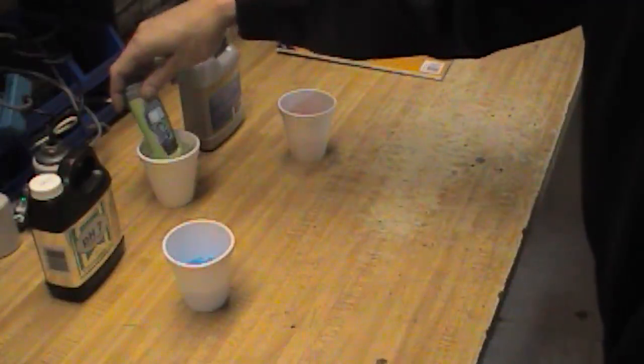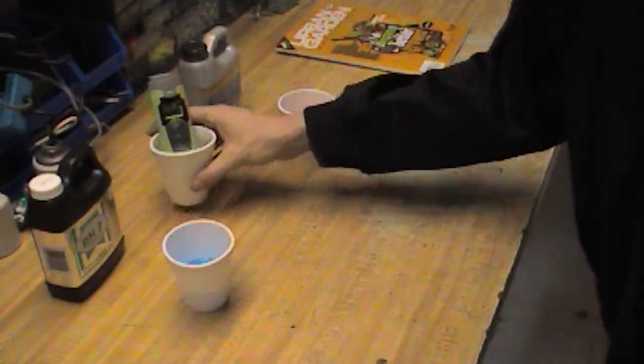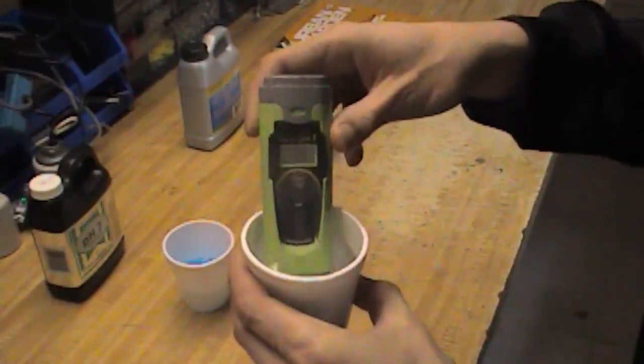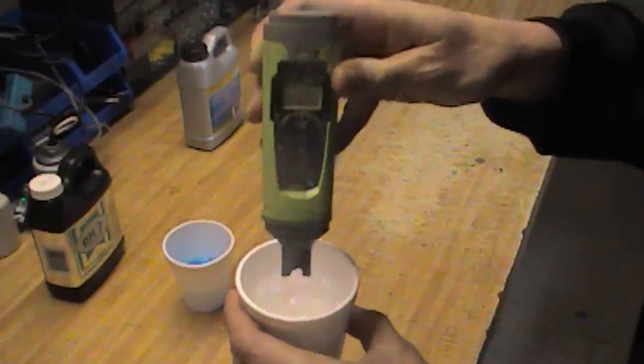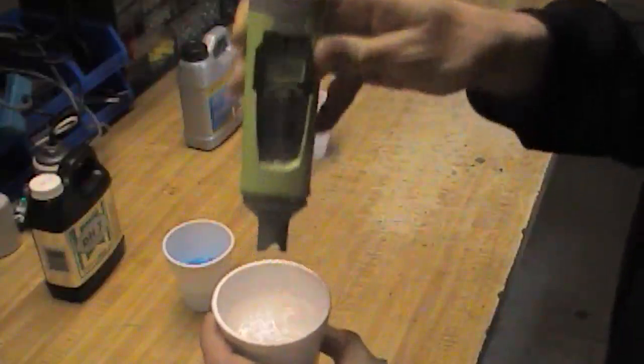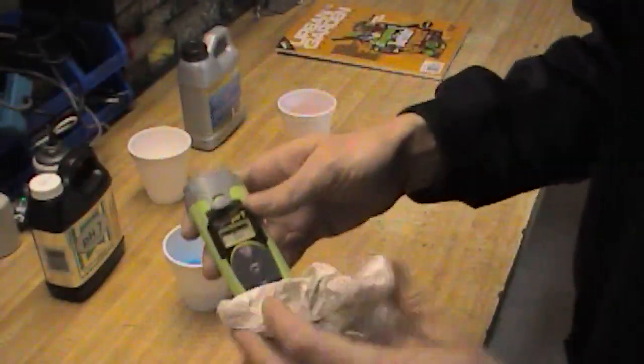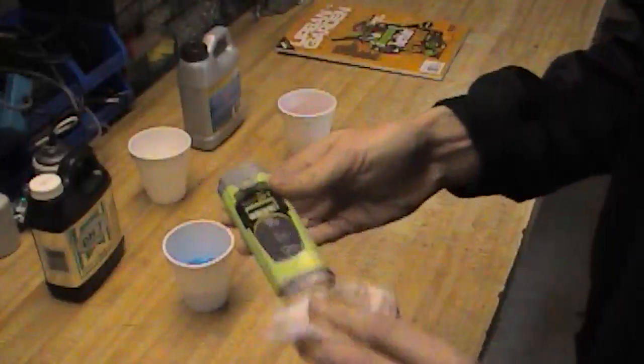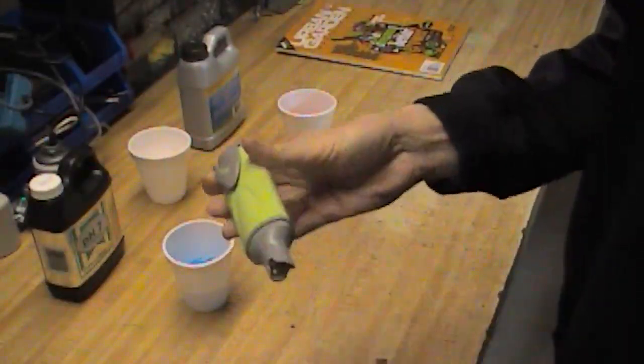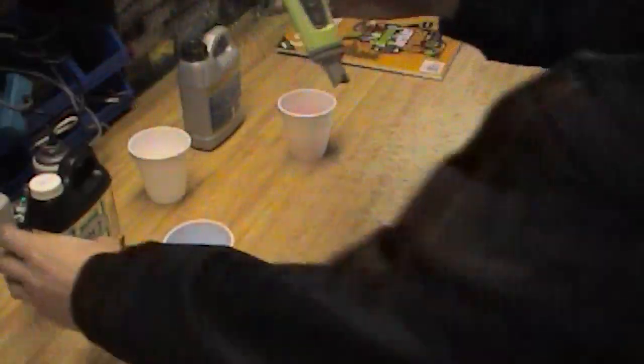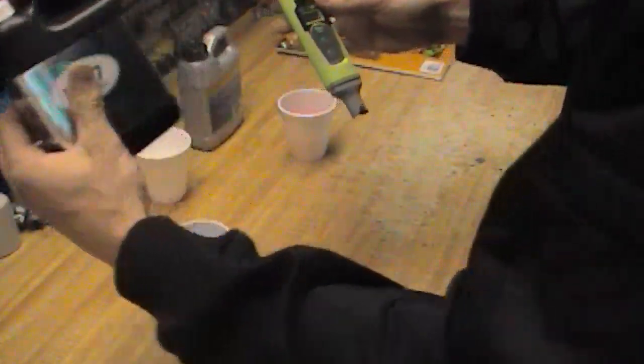At this point we're at 8.2, 8.3. I'm guessing the water is a couple points lower than that. It might not be because when it rains my tap water becomes a bit more turbid, the pH can increase, probably because of calcium bicarbonate or something in the water. So the first thing I'm going to do is put it into the pH 7 first.